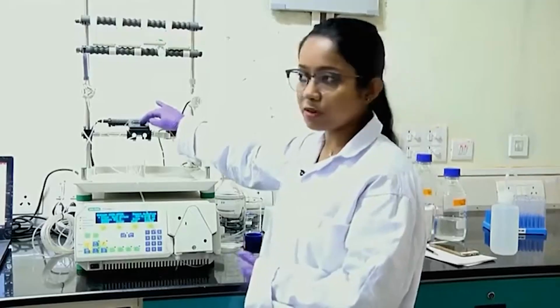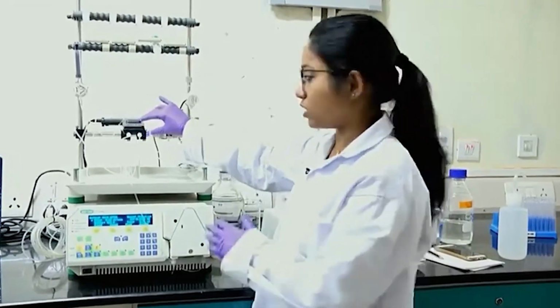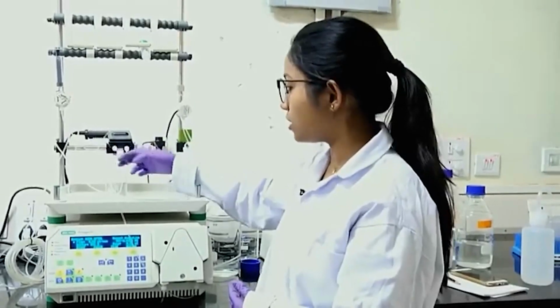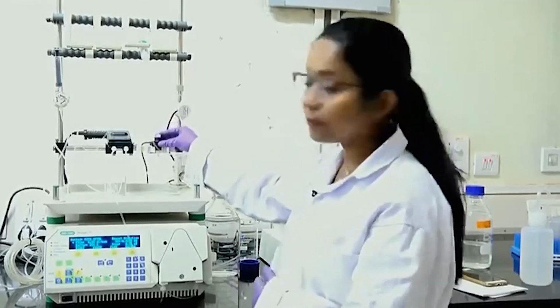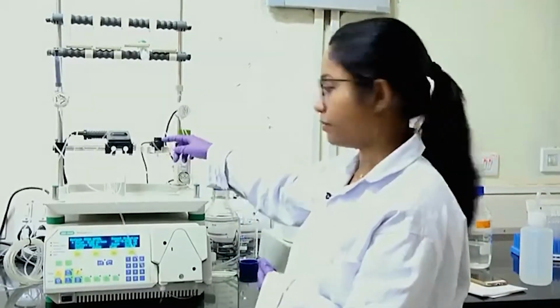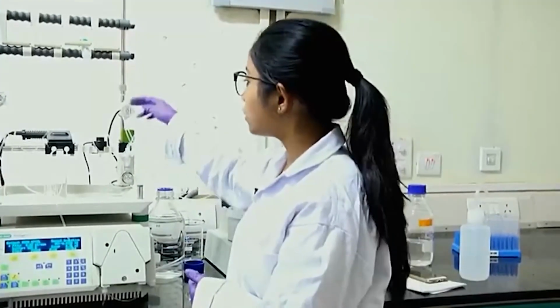From this column there is an outlet tube, and this tube goes directly to this particular holder. Here the UV lamp is there, and it will monitor the absorbance at 280 nanometer. Since we are using this for protein chromatography, this machine is set to read the absorbance at 280 nanometer. After it gets the reading for 280 nanometer, the flow will come out to the conductivity inlet, which takes the conductivity measurement, and then it can go either to the waste, since we do not need to collect the waste, or to the column collection.